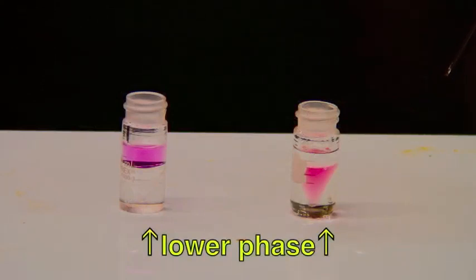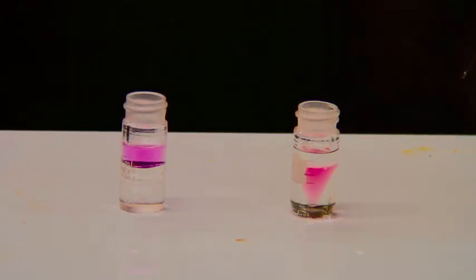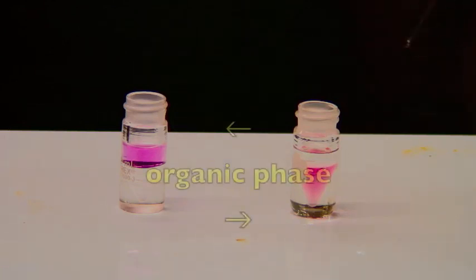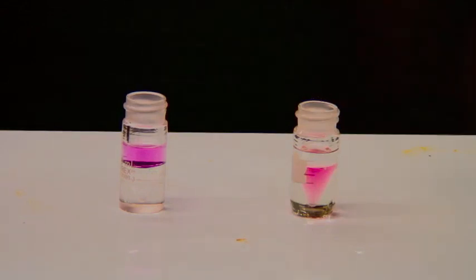When you are doing the separation, you will actually remove the lower phase of the liquid, that is the more dense liquid. Sometimes that's going to be the aqueous phase, as it is on this side, and sometimes it's going to be the organic phase at the bottom. If you're ever in doubt as to which one it is, just add a couple of drops of water to the liquid, and the water will actually join the aqueous phase. Watch carefully.